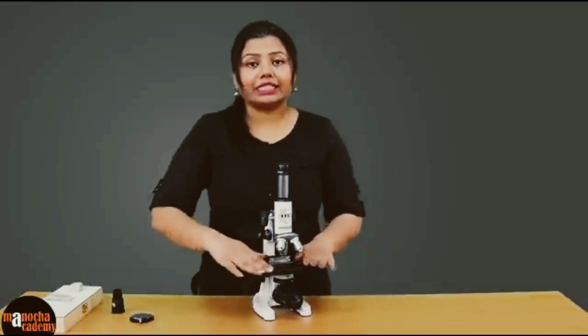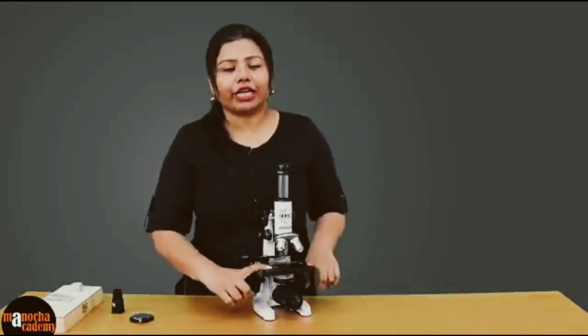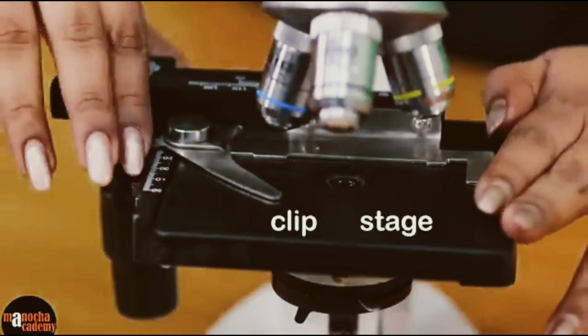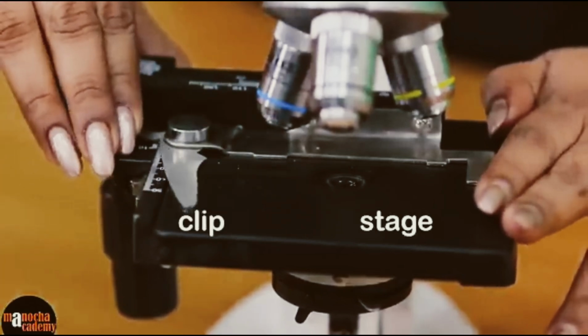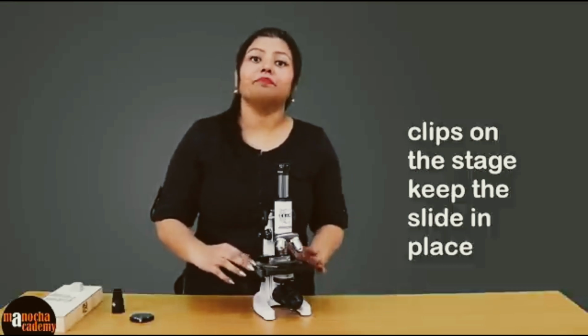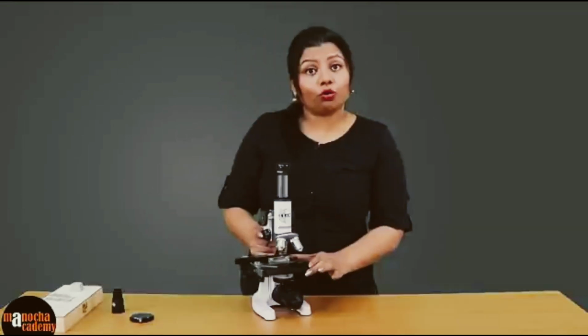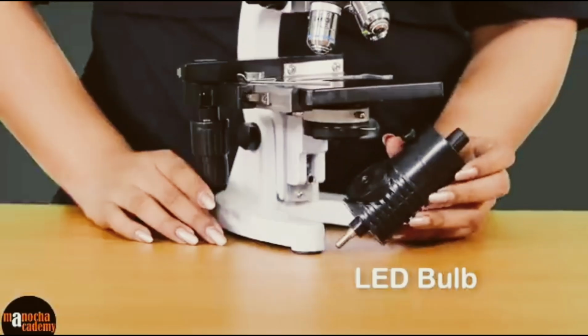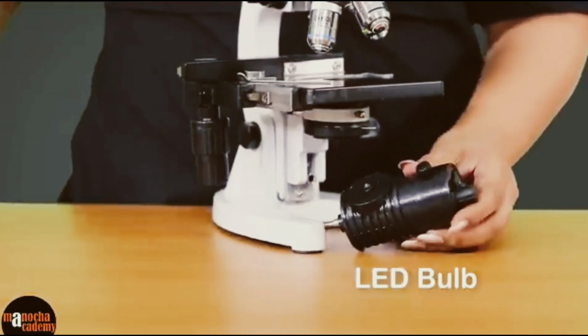Then you have this stage. This metallic stage is the base on which we will keep our specimen, and this base has been provided with clips which will help us to hold the slide in position. The source of light in this microscope is the LED bulb that we are using here.